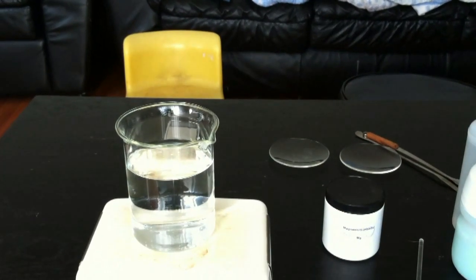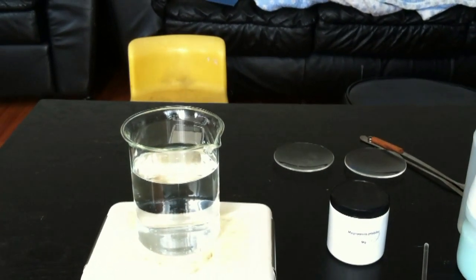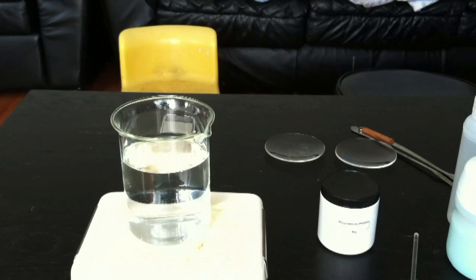Hi and welcome to Home Alchemy. Today we will be making copper 2 benzoate using the chemicals we made in our previous videos.